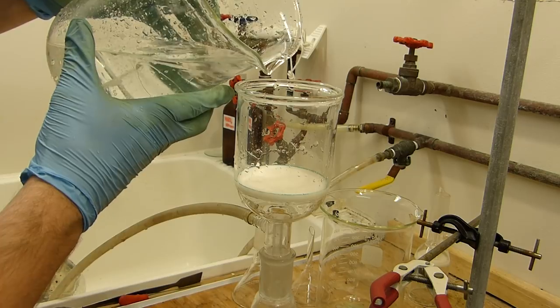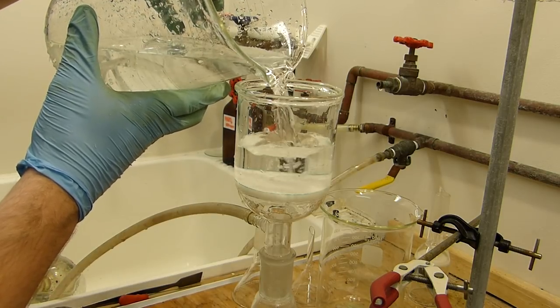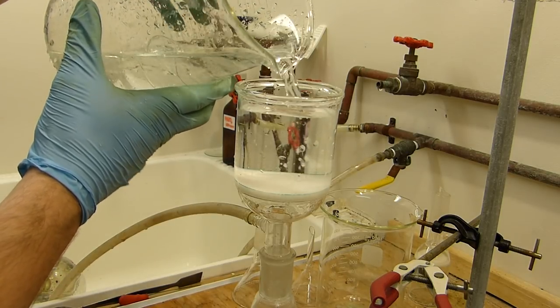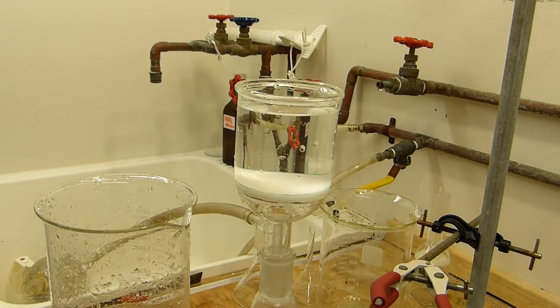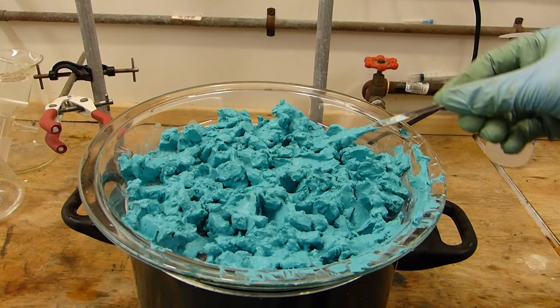I'll pull this through to get it into the frit. And I'll add some more. And this is going to serve to clean everything else, the joint, the beaker below, the funnel, everything.